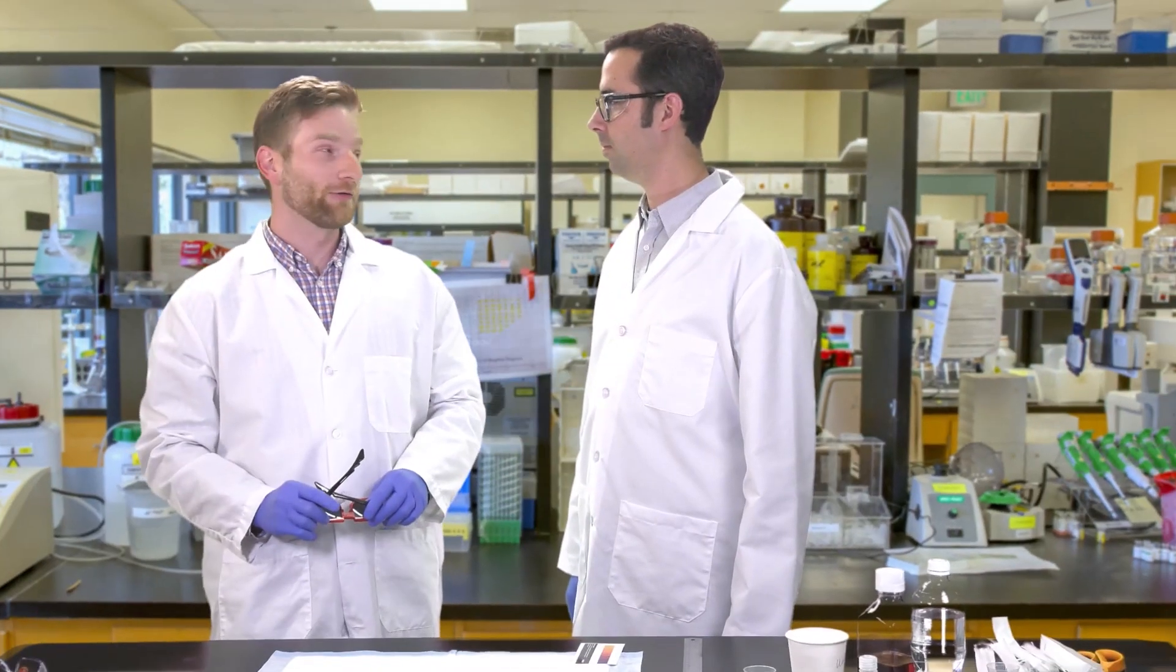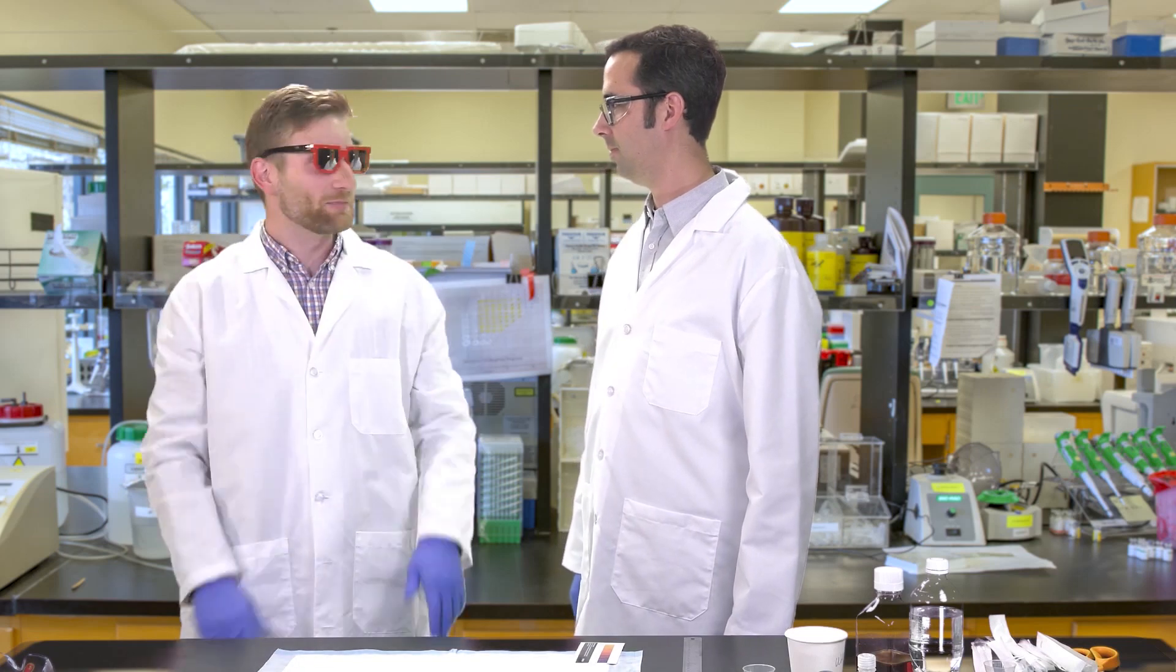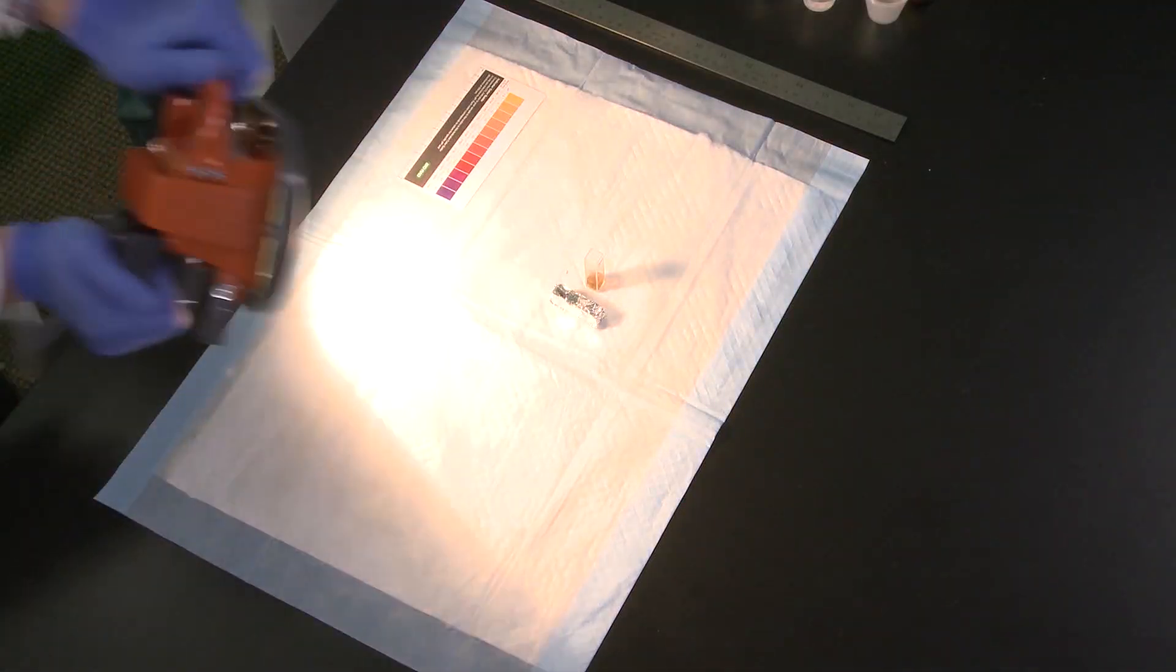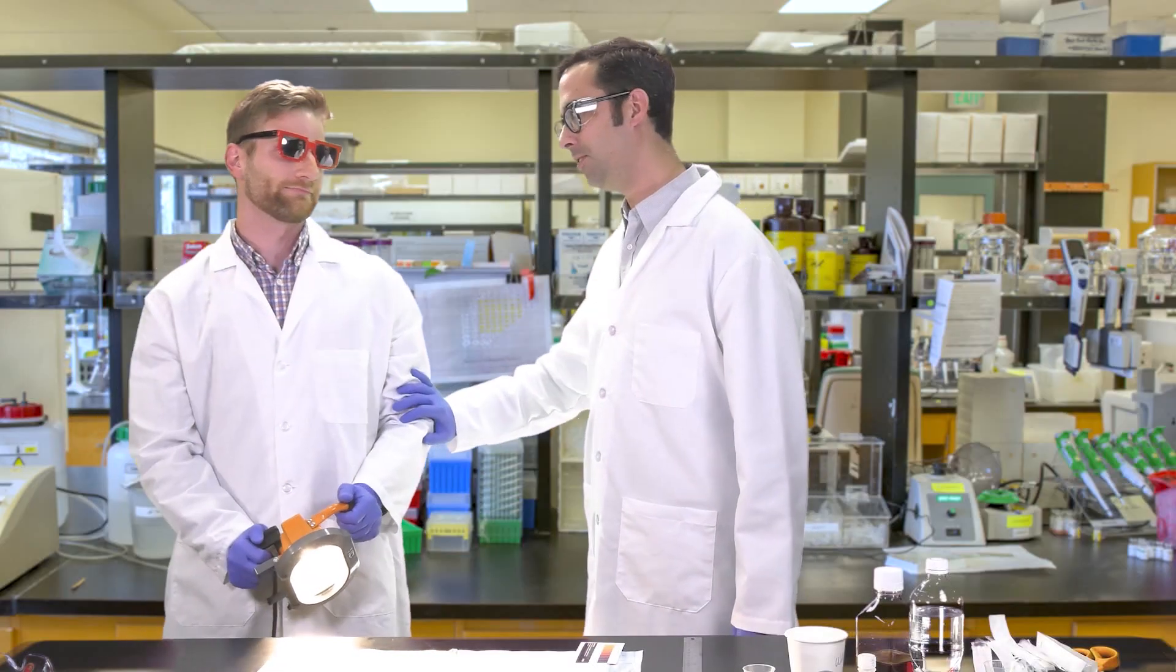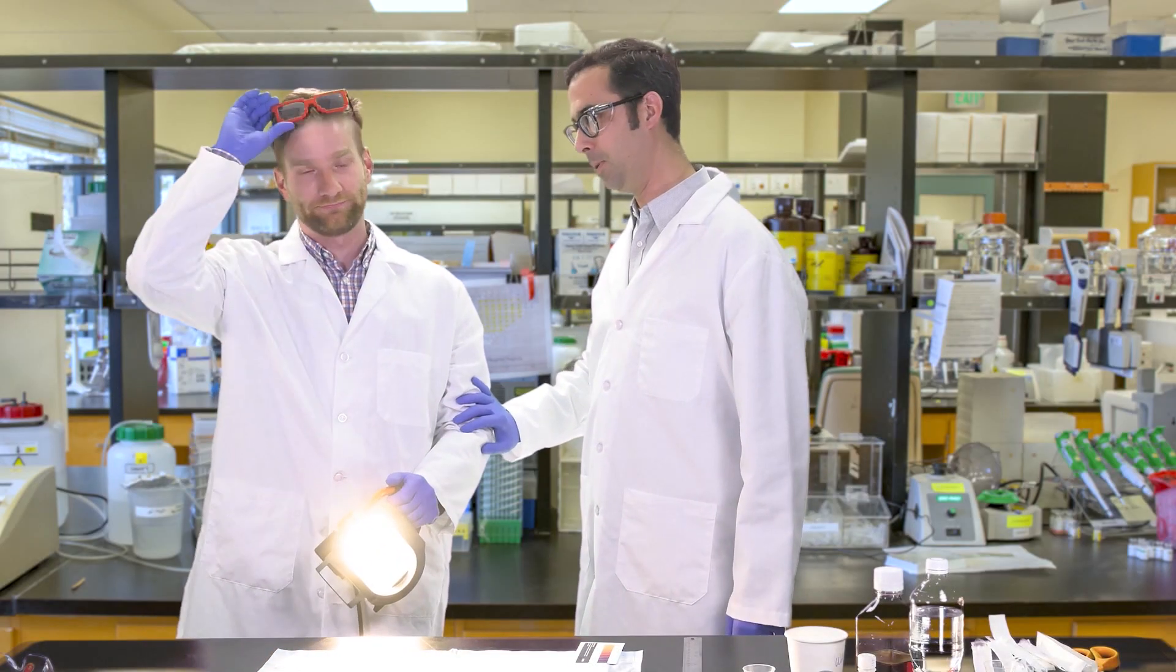Now you are ready to set up your experiment. All right, I got a great idea. Let's get these puppies cranking. Easy, tiger. There's a couple of things you need to keep in mind before you start your experiment.